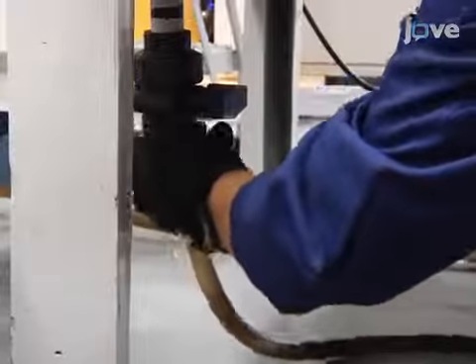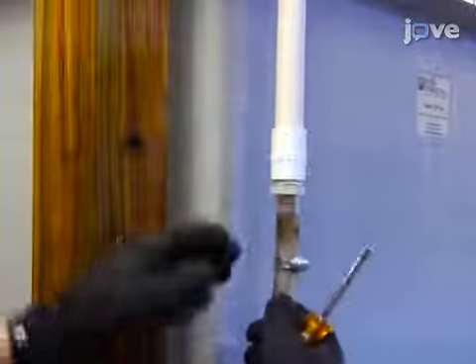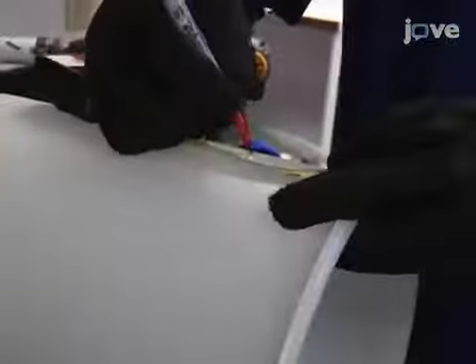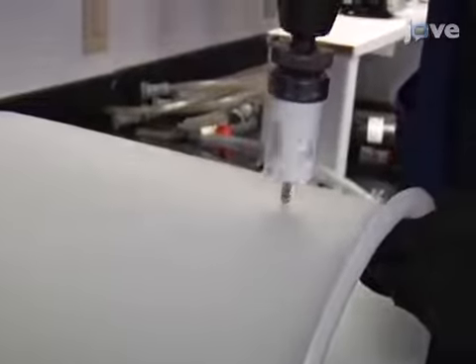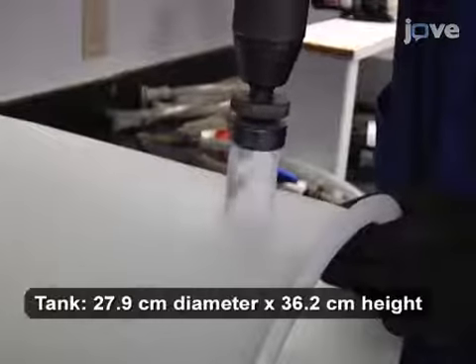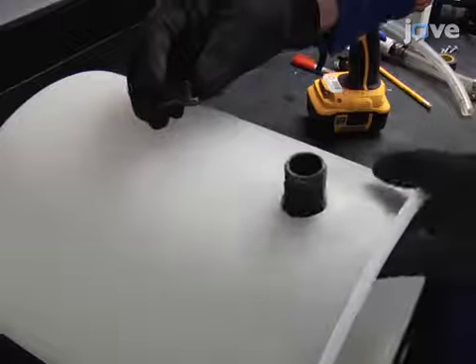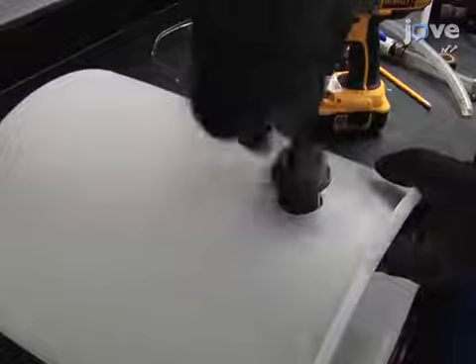Begin building and assembly of the module and water bath as described in the text protocol. To construct an overflow drain, use a hole saw to cut a 2.54 centimeter diameter hole 5 centimeters from the top of a 19-liter domed bottom polyethylene tank. Install a bulkhead fitting and an insert on the exterior of the bulkhead to serve as the overflow drain.